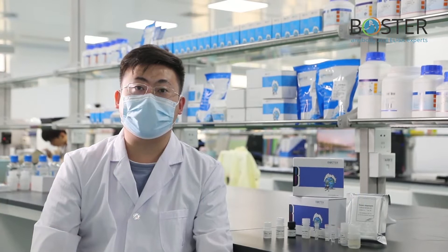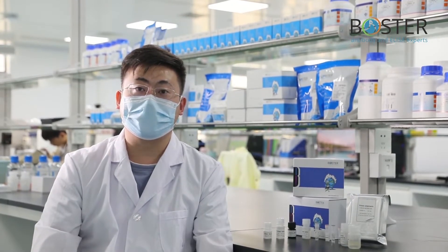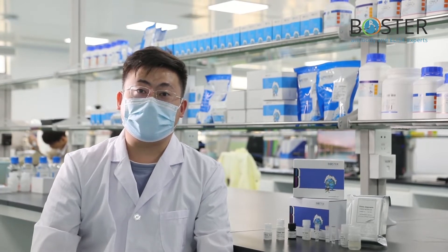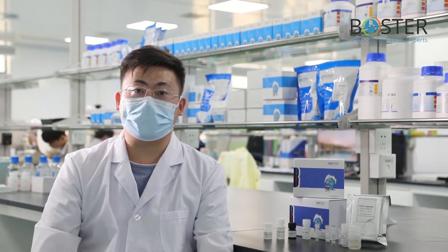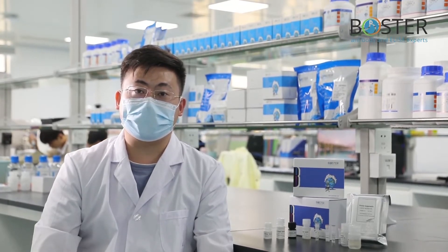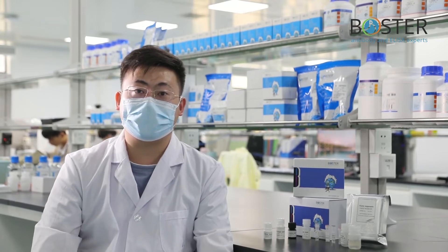Hello, everyone. I'm a technician in the ELISA Department of Wuhan Boster Biological Engineering Co. Ltd. Because of its high sensitivity and specificity, ELISA is widely used in the detection of antigens and antibodies in clinical and scientific research.